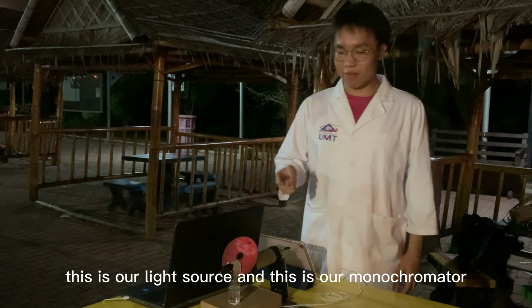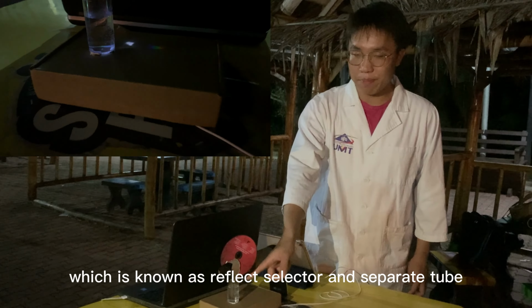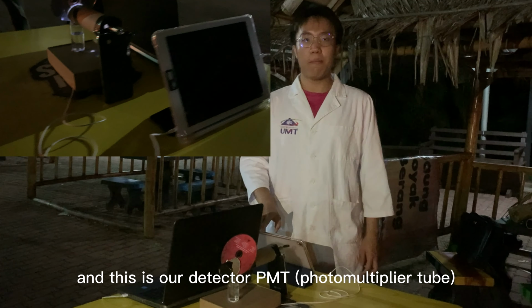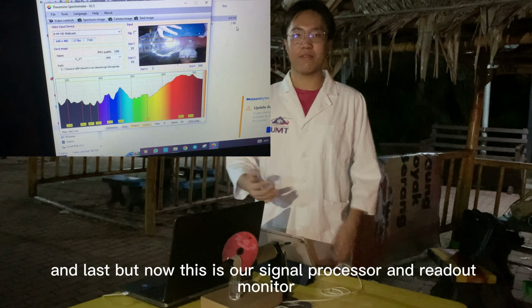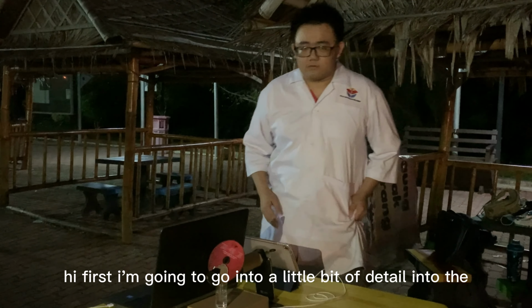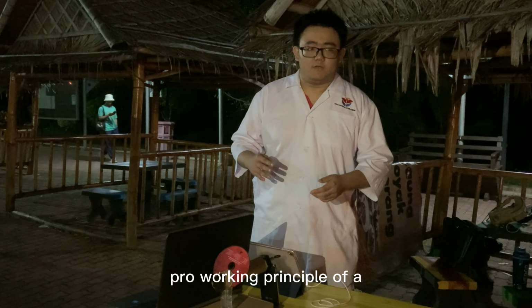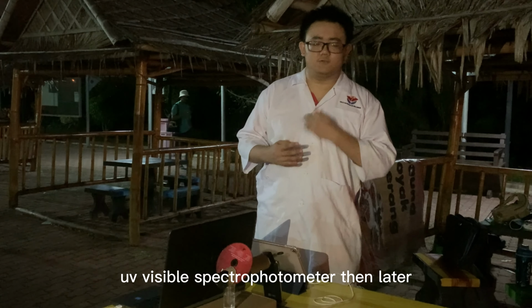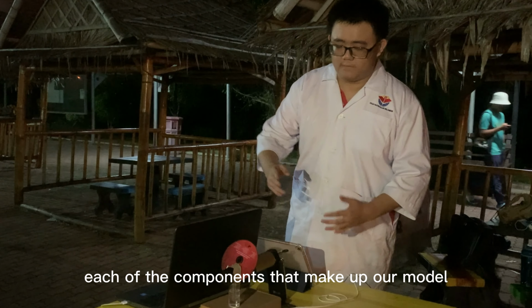First and foremost, this is our light source, and this is our monochromator, which is known as the wavelength selector, and the sample tube. And this is our detector, the PMT, photomultiplier tube. And last but not least is our signal processor and readout monitor. First, I'm going to go into a little bit of detail on the working principle of a UV-visible spectrophotometer. Then later we will talk about each of the components that make up our model.